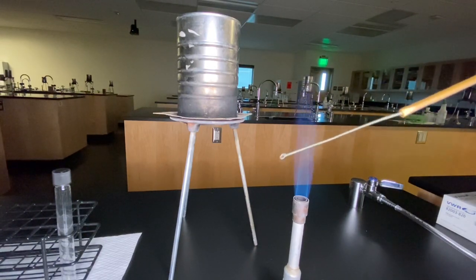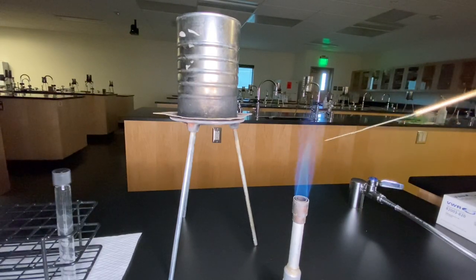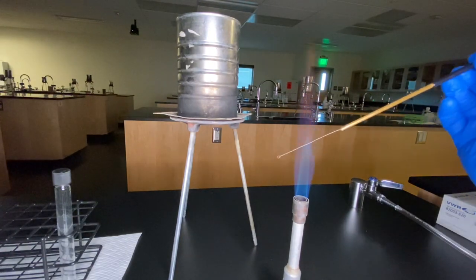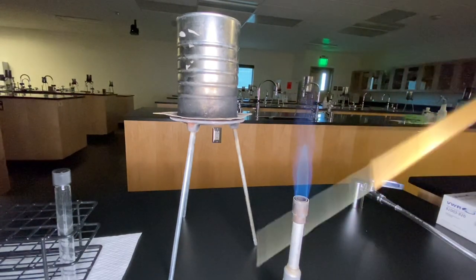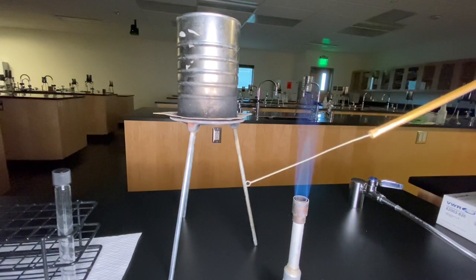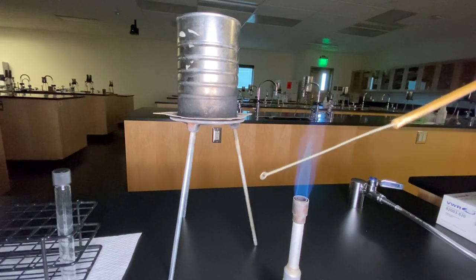We'll repeat it again: two-cone system, tip of the inner cone, pass it through once, twice, and let it sit for 15 seconds. You don't want to waft it around because you're picking up more particles, so just sit there quietly. The easiest way is to keep your elbow at the bench so it stays nice and stable and you're not moving around.